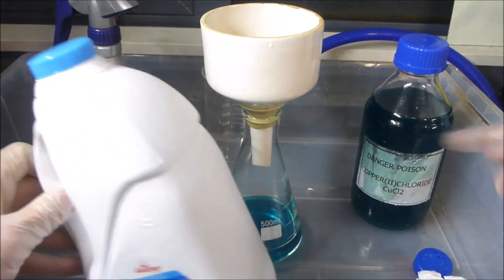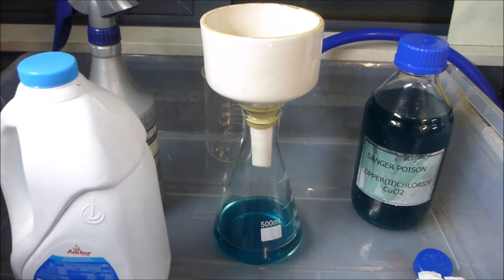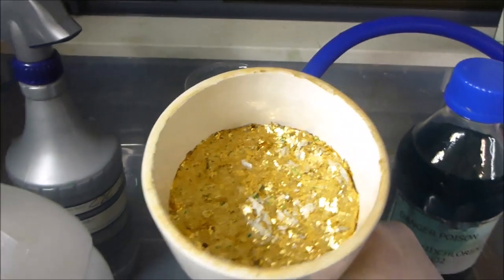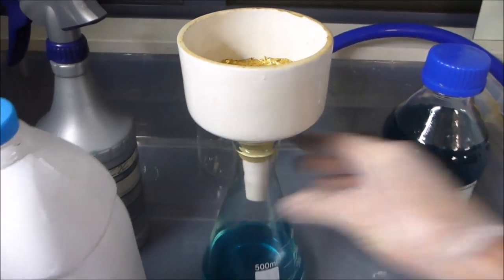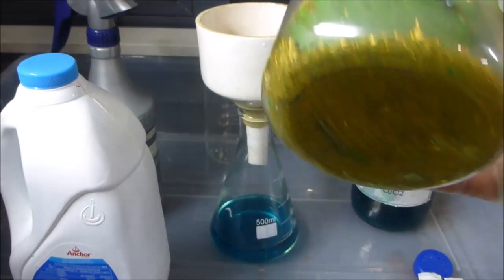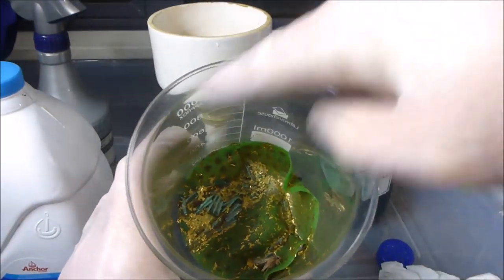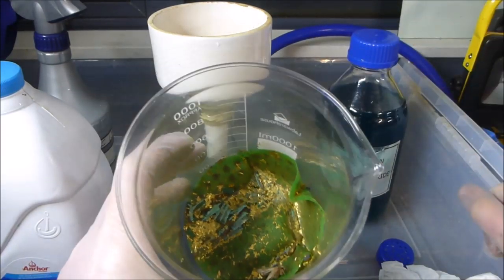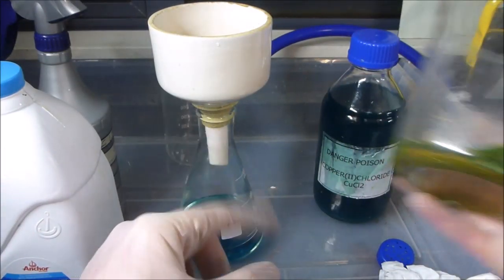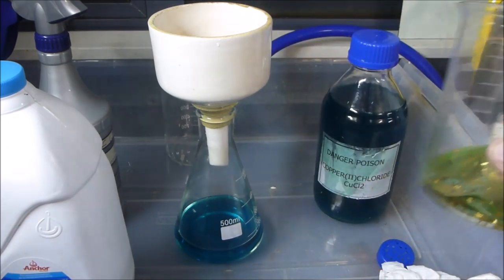So I'd basically fill this up, shake it, empty it out probably 3 or 4 times, and by then there's very little foils coming out of that. So yeah, just to finish us off, you guys can see what I've got there, looking pretty good. And just to give you some kind of context, these foils here, same kind of thing. As you can see, there's a whole bunch of regular filters in there, and they're the fairly large size Büchner funnel filters, and I went through a whole bunch of them, and roughly doing the same amount of foils, this was probably about half a day's worth of filtering versus probably about an hour or so for that.